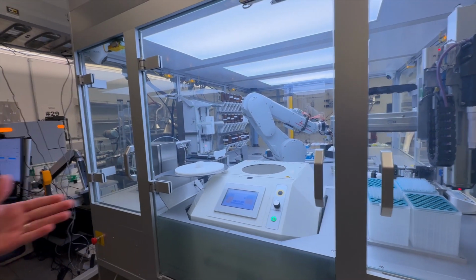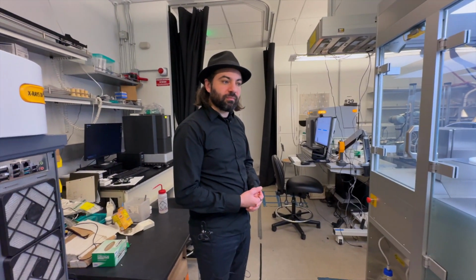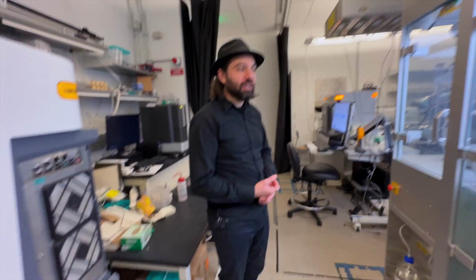but in this situation here, this machine works with the whole software that Labman made to make this flow work well. So it sounds like it's a really collaborative process with the vendors where you're giving them your requirements and they're saying challenge accepted. Yes. Are they actually coming into this space and looking at dimensions? Many times.